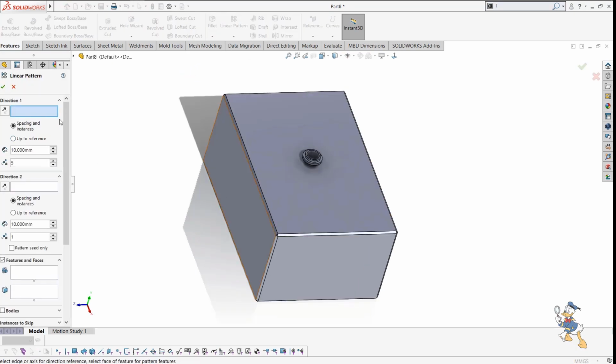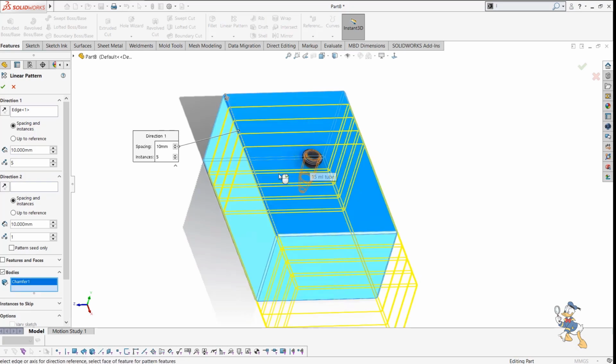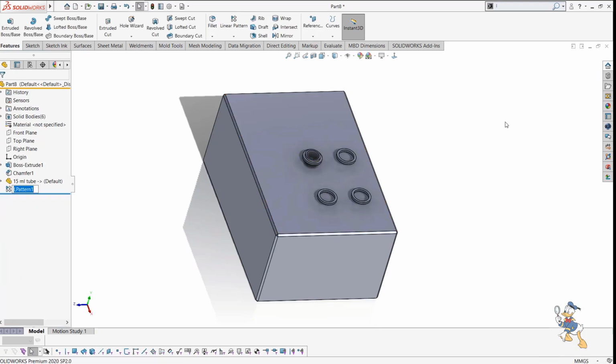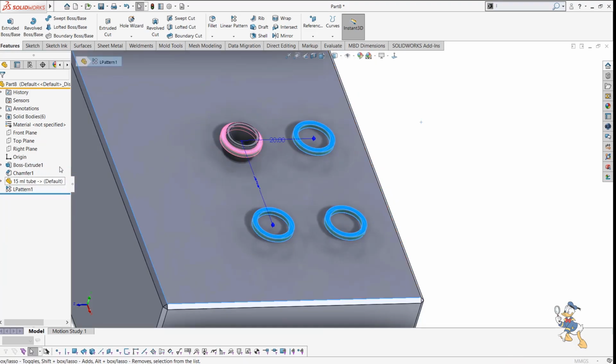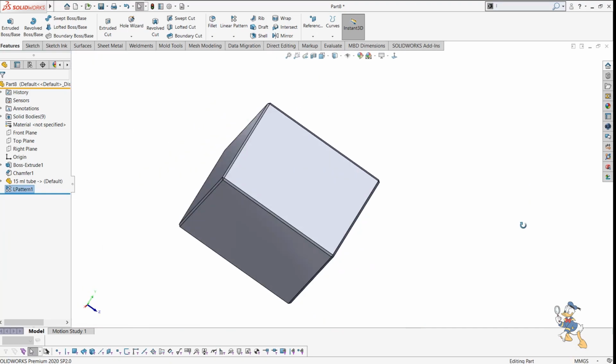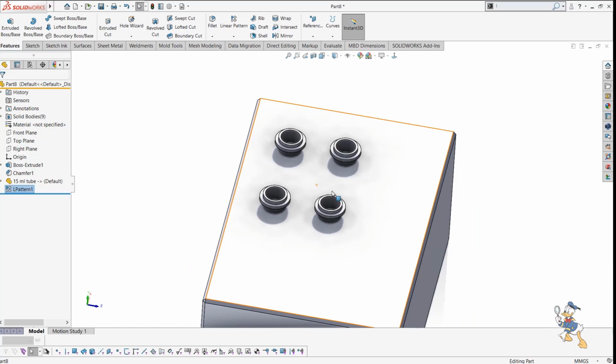And suppose I need to generate some sort of pattern of this body. So I just need to select the direction and which body to pattern. It would be a testing tube, definitely. The instances would be 2 with a value of 30, and the other direction would again be 2 with a value of 30, or it could be 20. We have selected this body as well. So now we have generated a 4-tube pattern in the block.